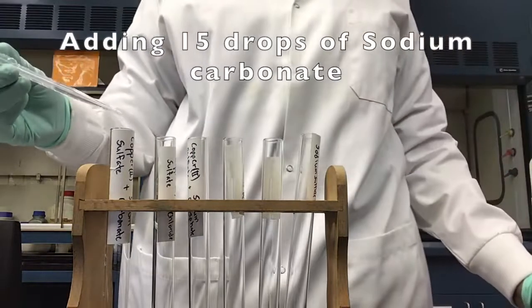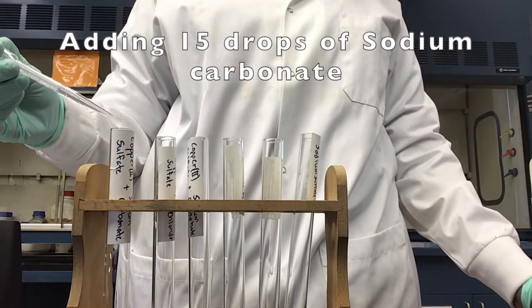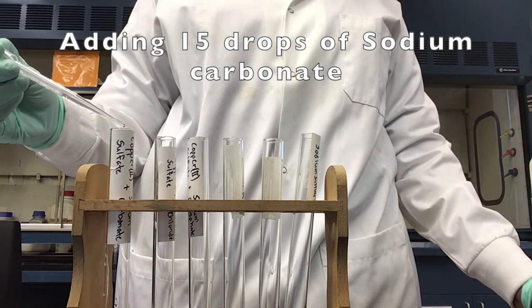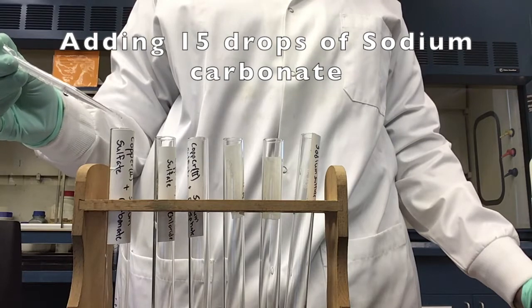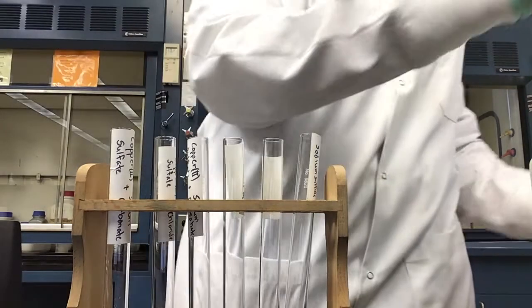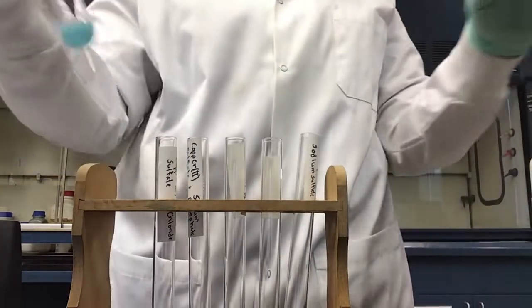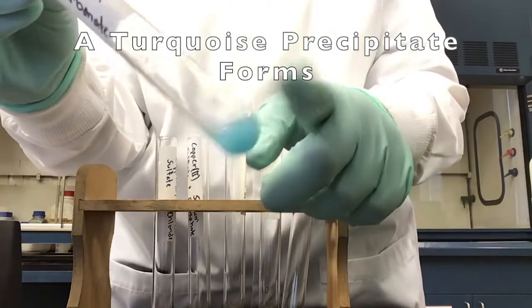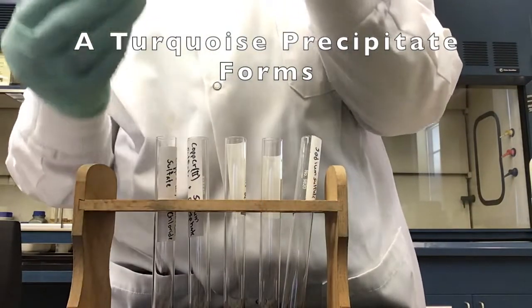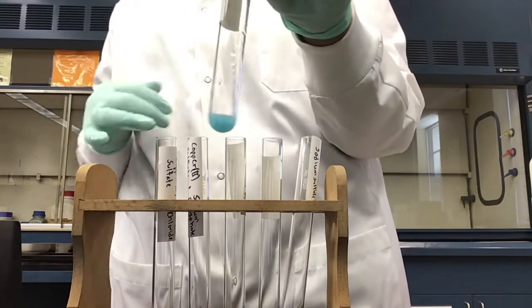Next, we're going to add 15 drops of sodium carbonate to the same test tube with our copper 2 sulfate. After copper 2 sulfate and sodium carbonate are mixed together, we lightly tap the tube to mix the solution. We see that a turquoise precipitate forms in our test tube.